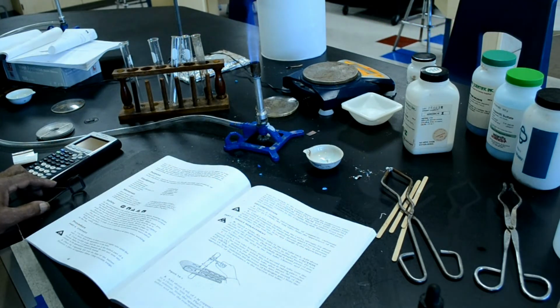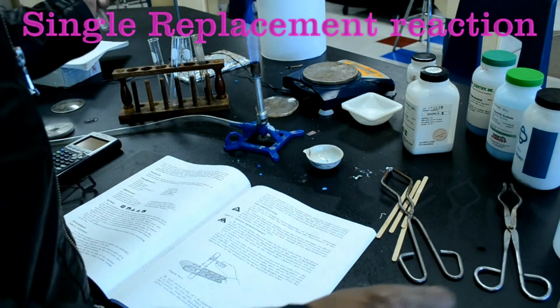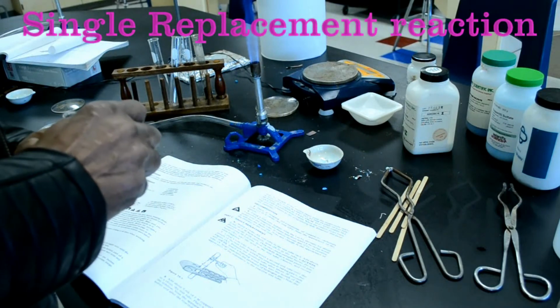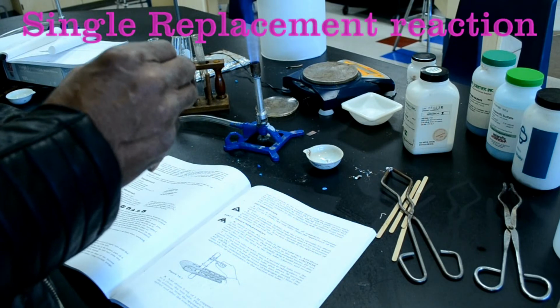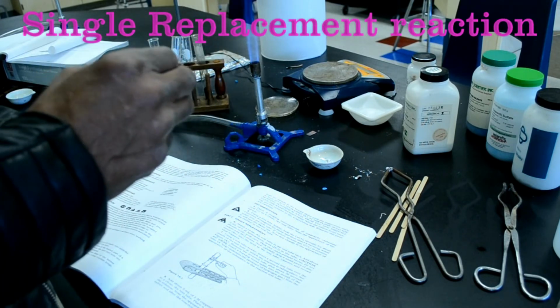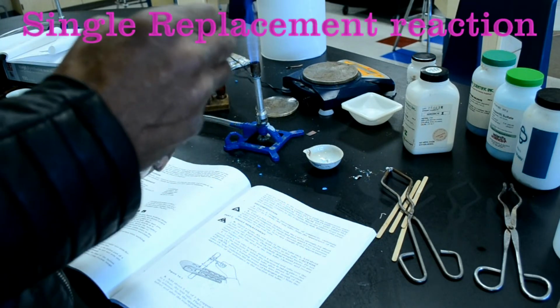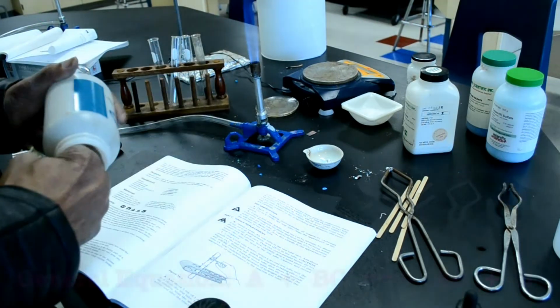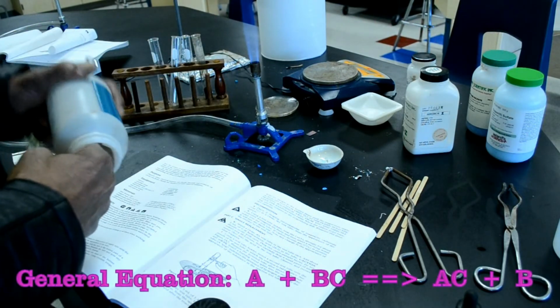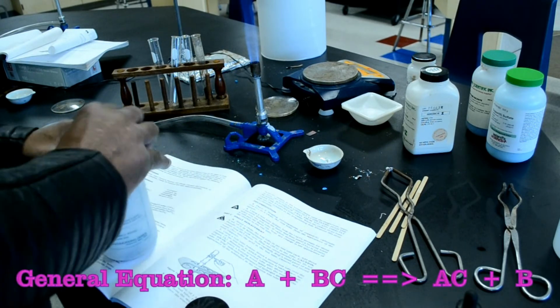Number 6, stand a clean, dry test tube in the test tube rack. Add about 5 mLs of 6 molar hydrochloric acid. Just going to add a few drops here. Drop a small piece of zinc in the acid in the test tube. Observe and record what happens.